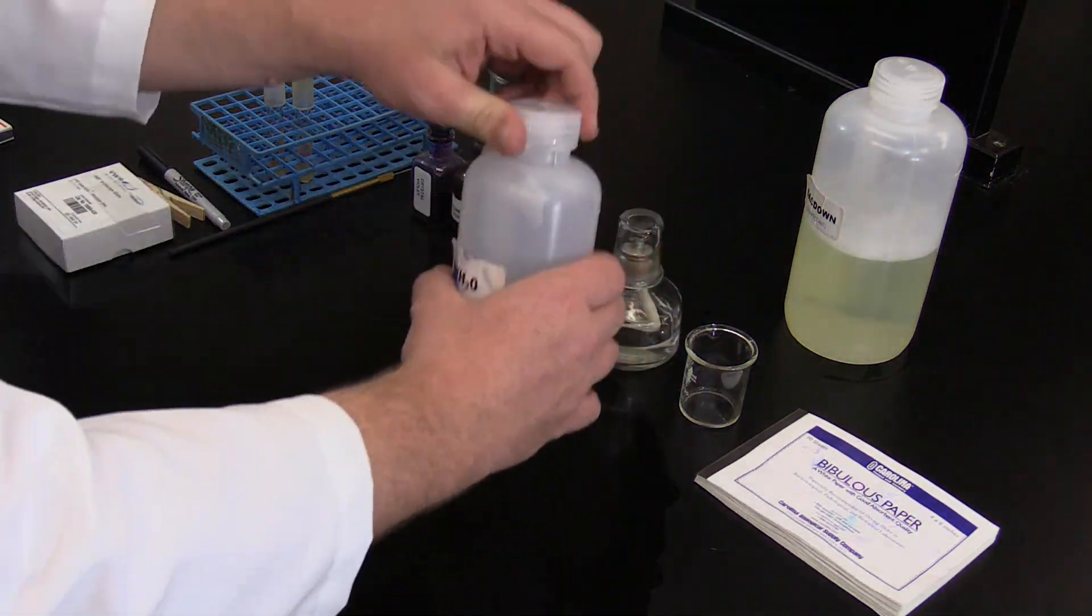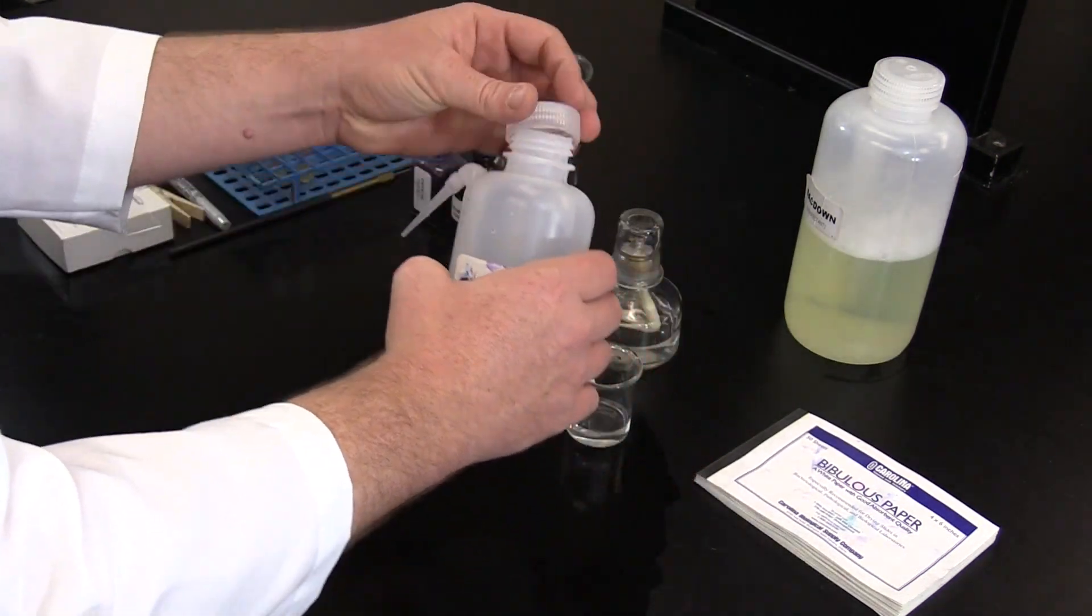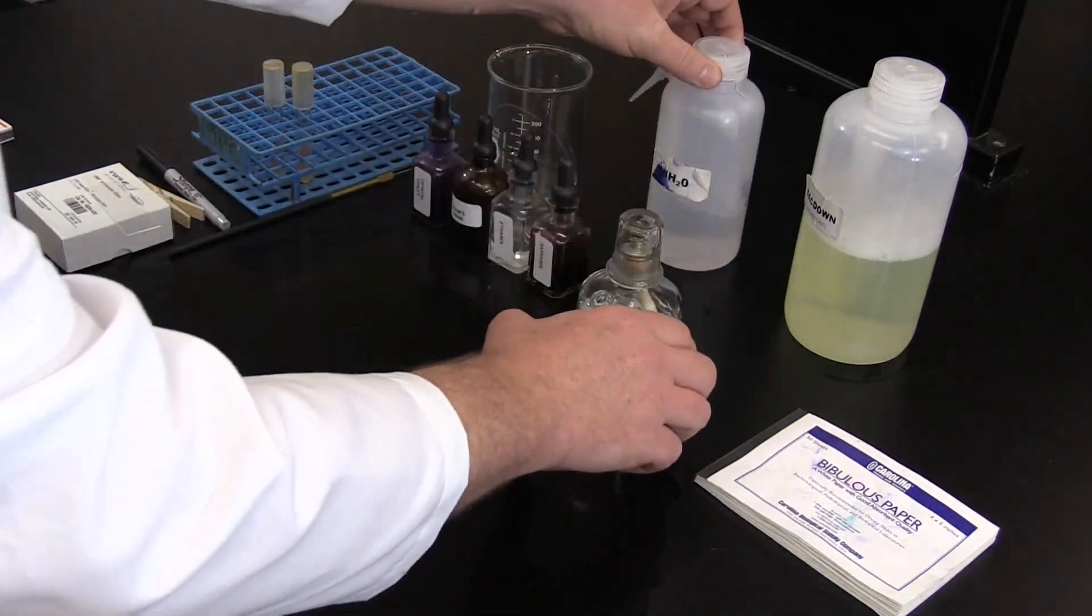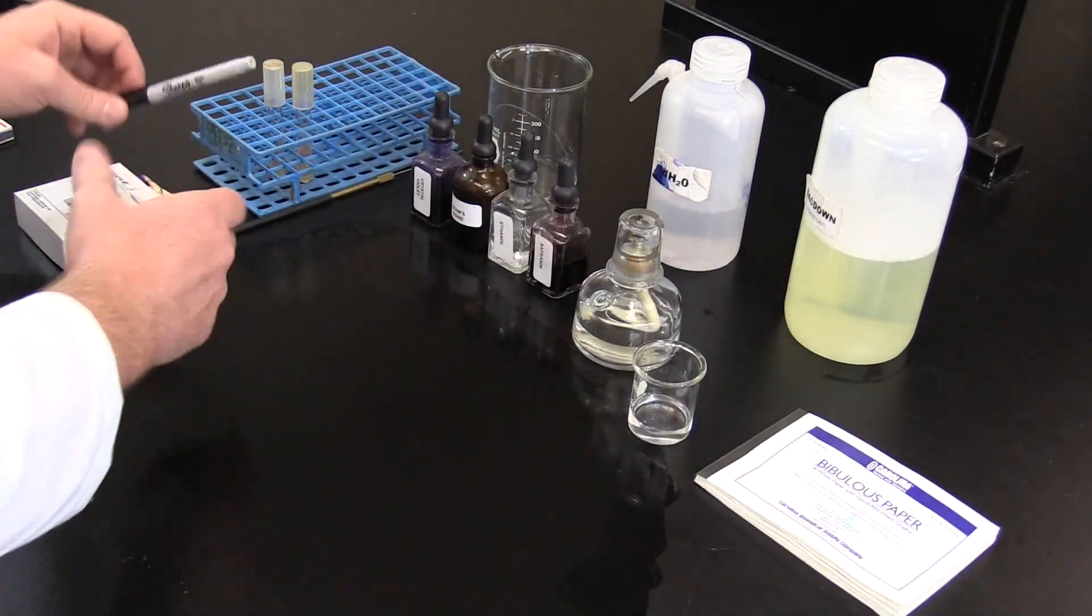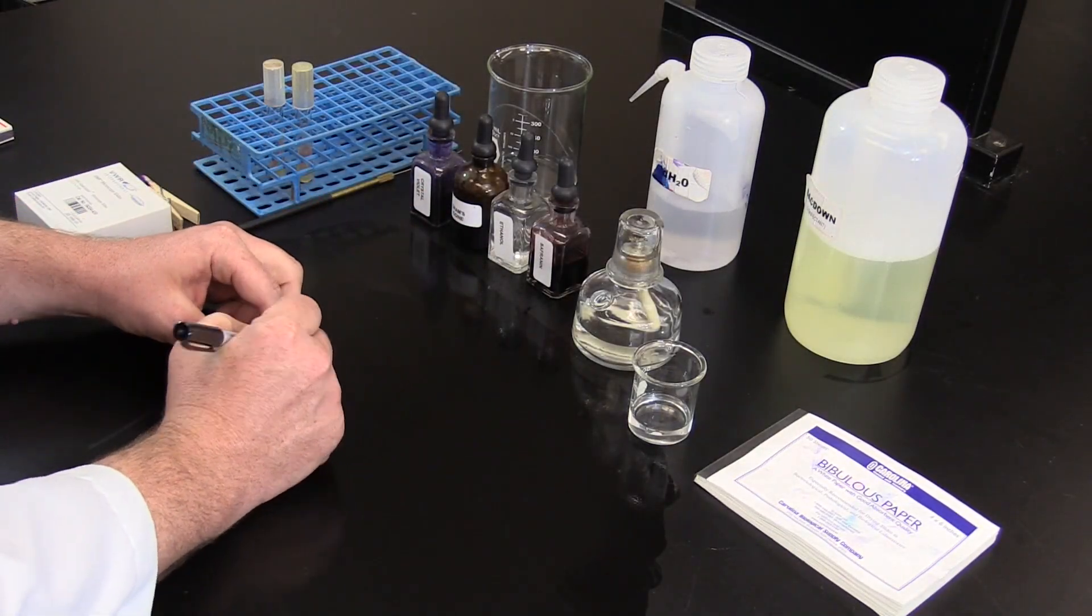Next, pour a small amount of water into the beaker. Using a permanent marker, label the slide with the sample name or the organism being tested.